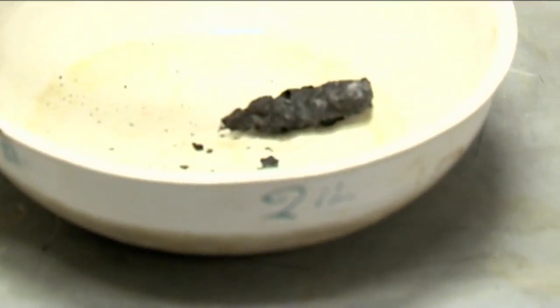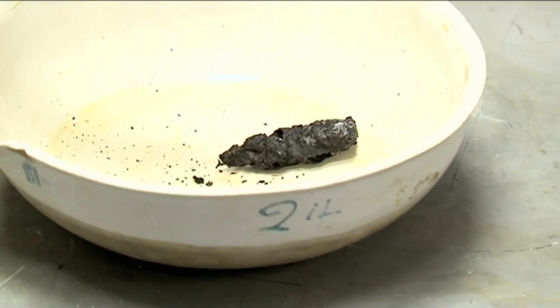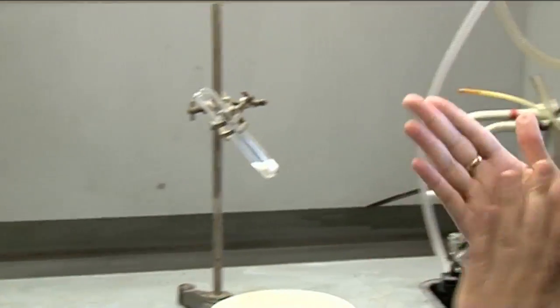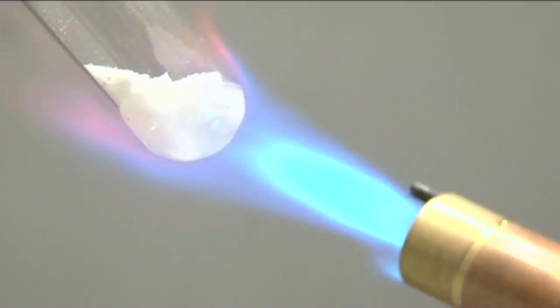I think in the interests of scientific endeavour, we need to do this experiment again with a different coloured jelly baby. So we did red jelly baby. That's my favourite flavour. But we'll do green this time because I can't stand those.